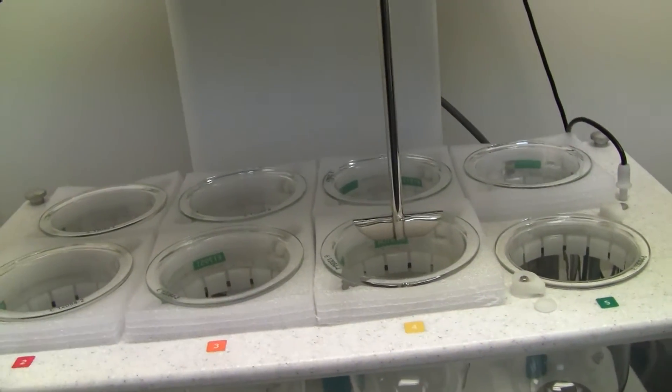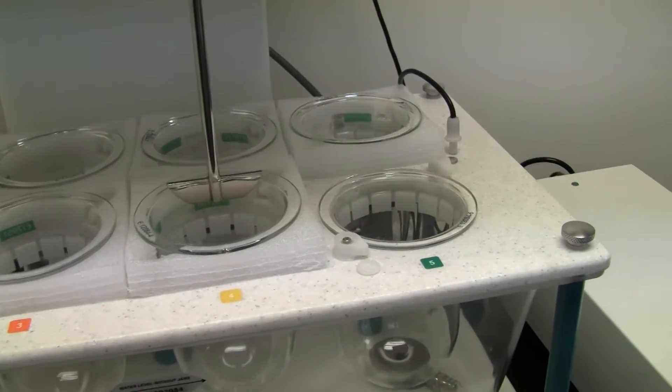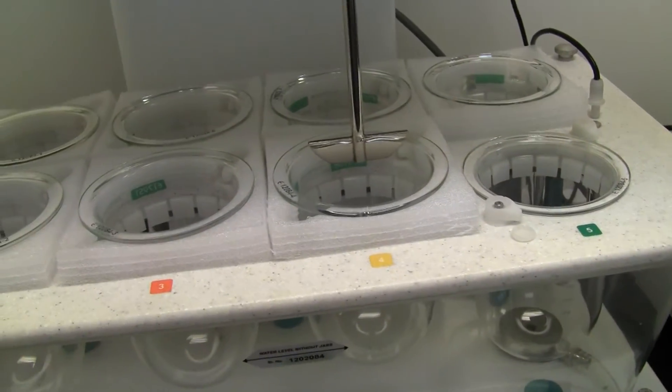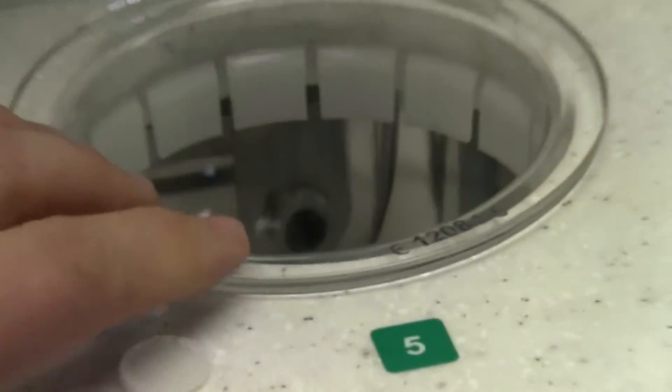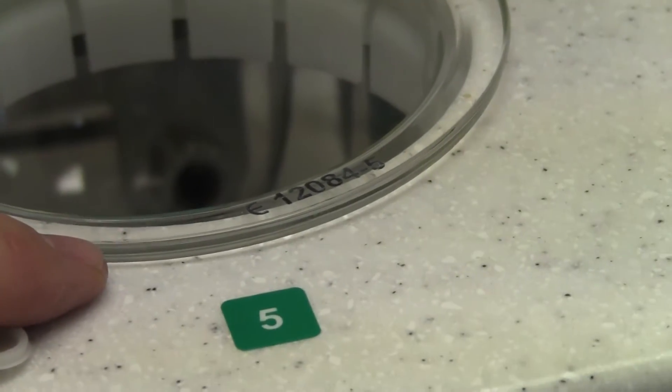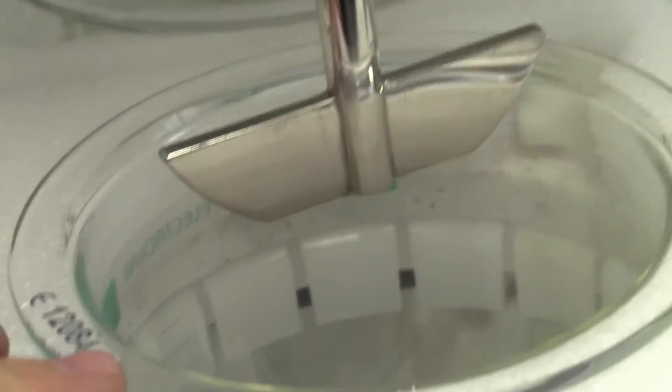Each paddle is numbered along with the jar, so that's very convenient to know that. Let's turn this right here. Jar number six goes with paddle number six. You'll see, let's see it right here. Paddle number four is in with jar number four.